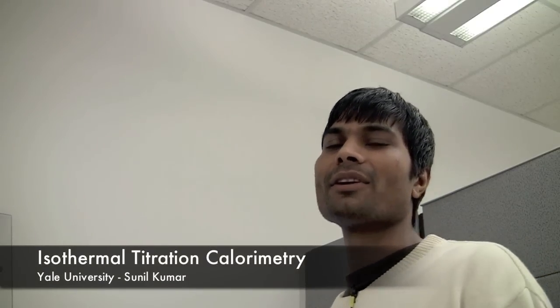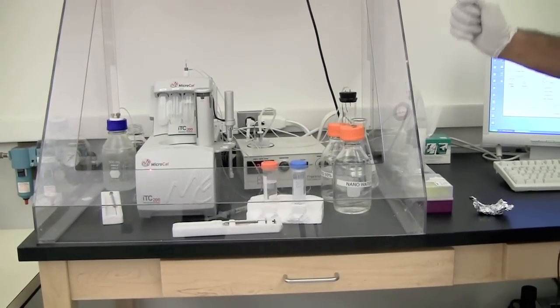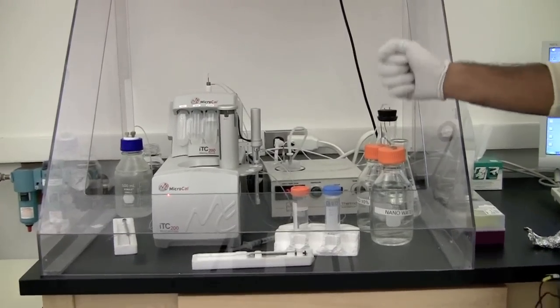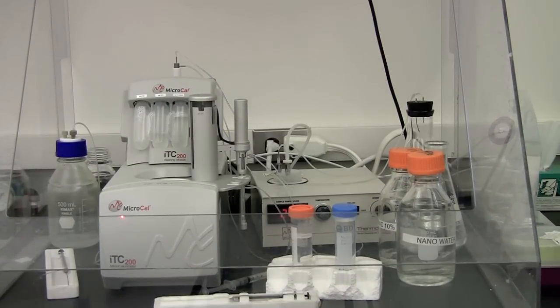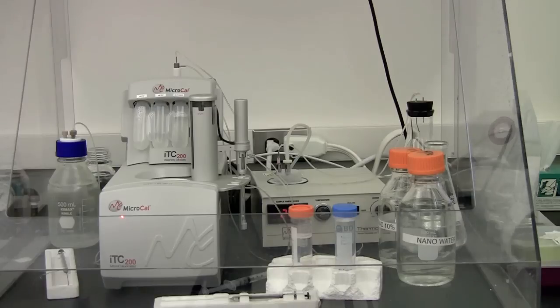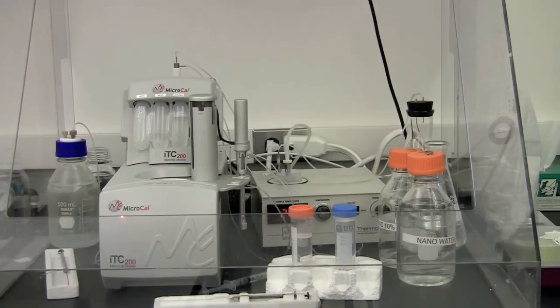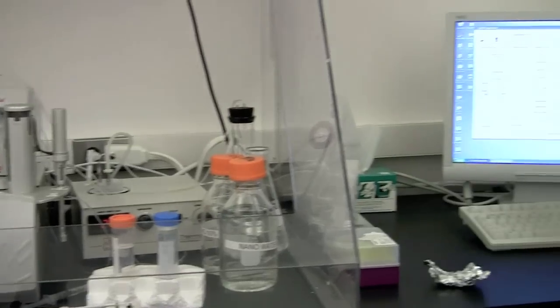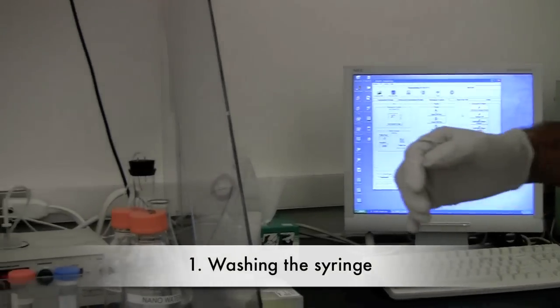Hey, this is Sunil Kumar and today I'm gonna show you how to run a successful ITC experiment. This is the ITC instrument and it contains a reference cell and a syringe. The experiment is divided into five parts: wash the syringe, wash the cell, fill the solution in both syringe and cell, set up the experiment on the monitor, and start it.